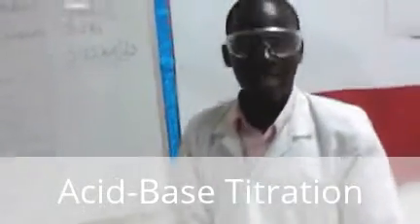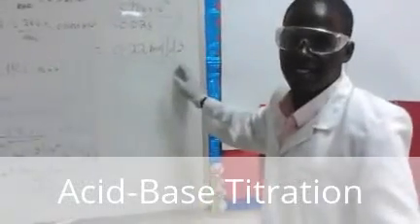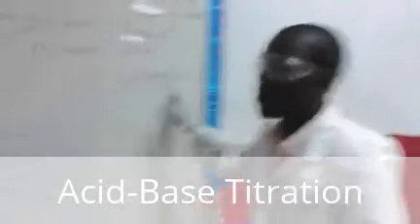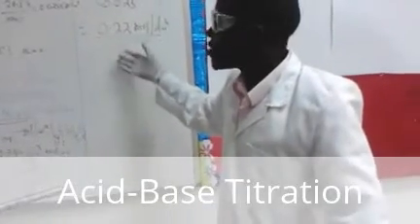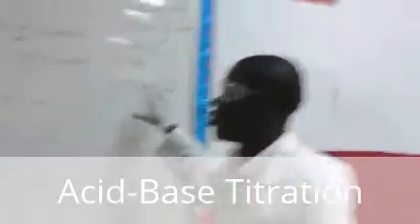So, ladies and gentlemen, our final concentration. The concentration of the sodium hydroxide, which was provided to us by the examiner, is 0.22 molar. That means our unknown concentration, sodium hydroxide, which was given to us as solution A, is 0.22 molar. What does that mean? The mole ratio is 1:1. If our acid was 0.2, still our unknown solution is 0.22 molar.